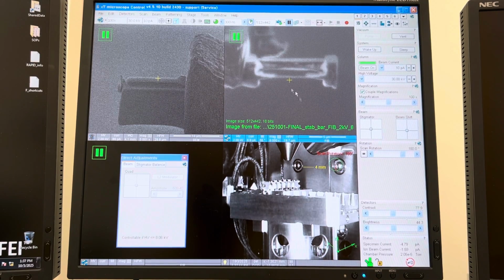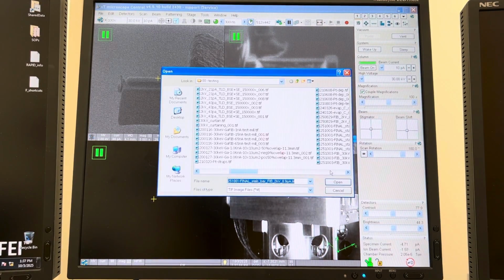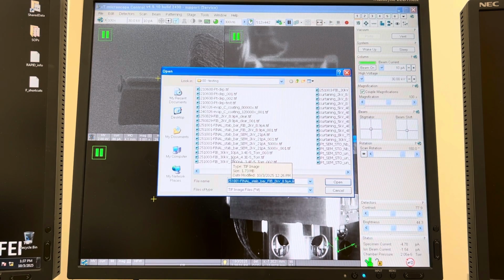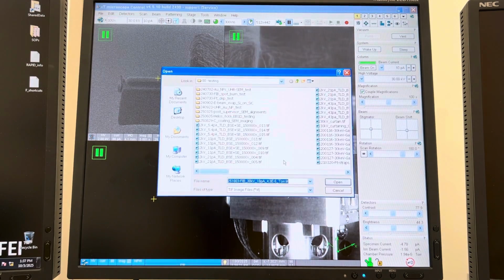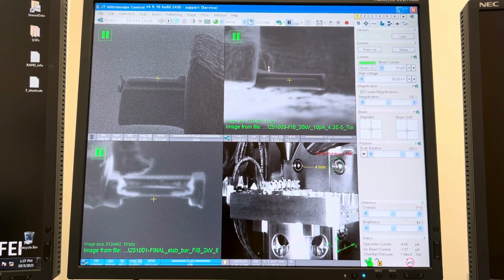I think the image I just showed you was better than this, but not by a huge margin, at least not in my opinion. Let me pull it back up here, because I saved it. That's 10 picoamps. Maybe what I saw here was 1,000, I'm not sure. And then let me open up the 2 kilovolt one. Okay, so yeah, this is definitely better than this. But at the same time, you can see the effect of having a good vacuum. That's a great low kilovolt image, but that's enabled partially by the fact that the vacuum's really good, okay?